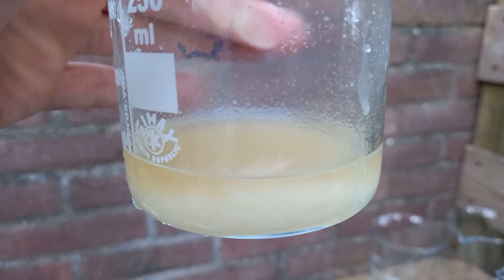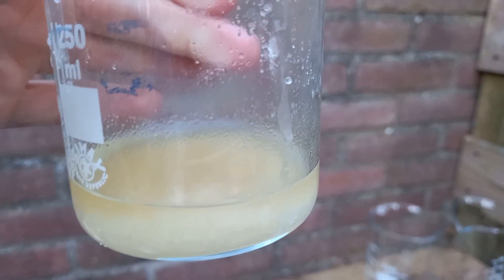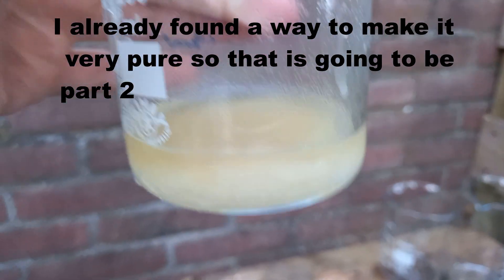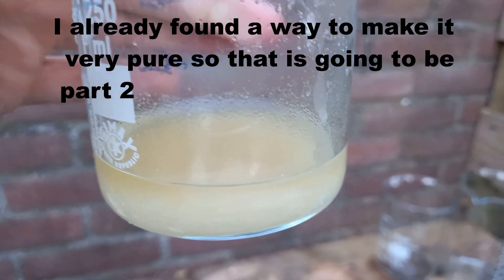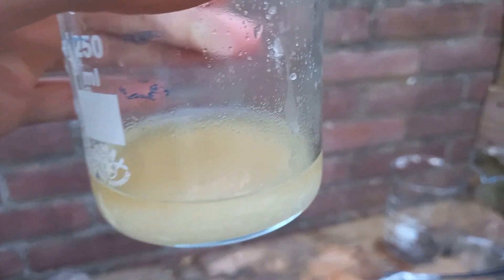I don't even know the proper term for making tetrazole. I don't know if it's really pure enough for these purposes, but let me know if this is actually useful for diazotizations or whatever, because I have no clue if these kinds of impurities have any effect on it.